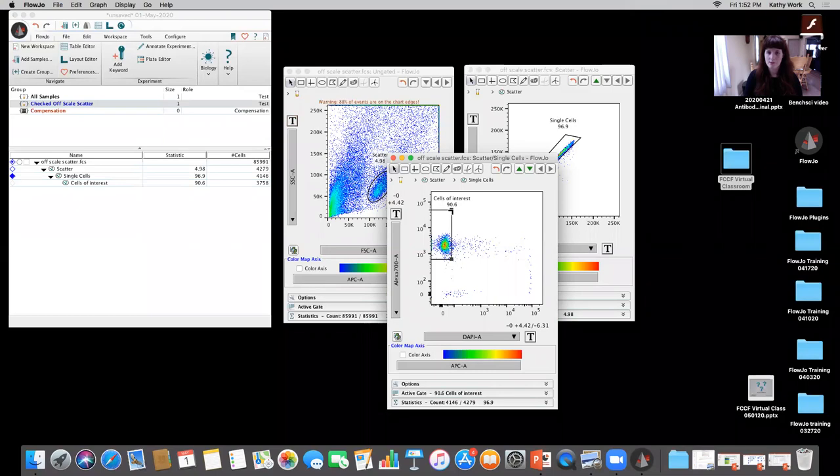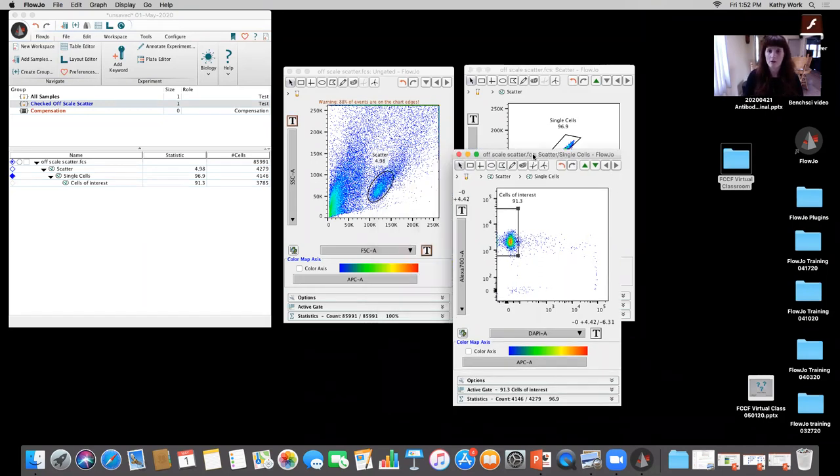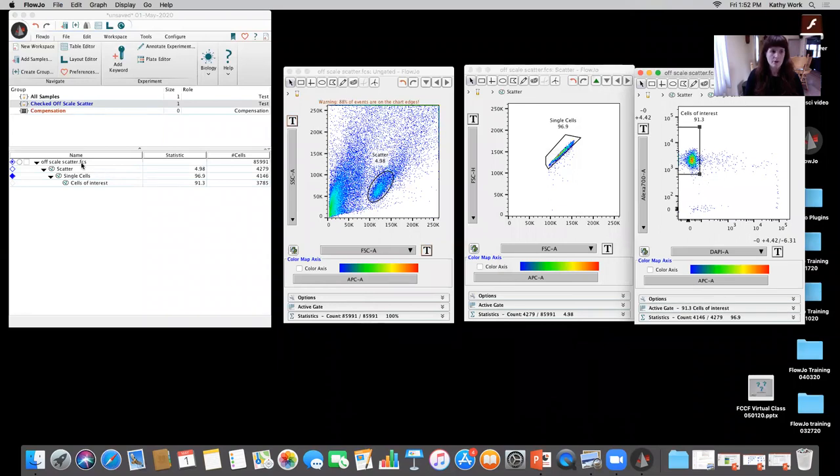So it's 90.6%. This is how they went ahead and did their gating, and this is how they went ahead and sorted their cells. Okay. I'm going to show you an alternative approach that I would take. One, I would adjust the forward and side scatter voltages, kind of like I showed you for the Cytoflex. I would do something similar there to make sure it's within the appropriate range and also on scale a bit more. But now that we have this one up, I'm going to show you an alternative method.